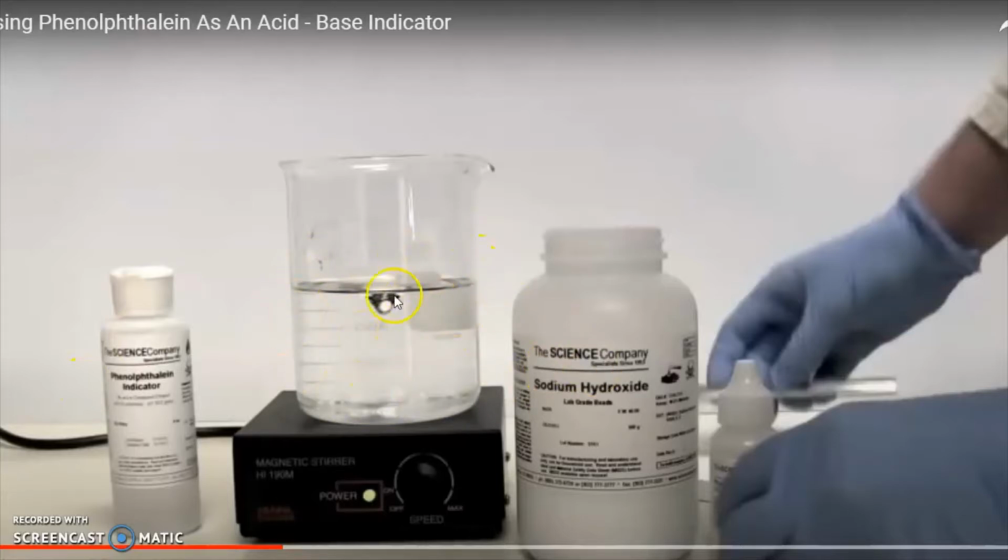In the beaker right here is sodium hydroxide, which is NaOH, which is a base. And then this person is going to add some indicator that's called phenolphthalein. You can see the name phenolphthalein on this little bottle over here. It's got a really weird spelling. But phenolphthalein turns pink when it's in a base. So it's clear if it's acidic or neutral, but it's pink in a base.